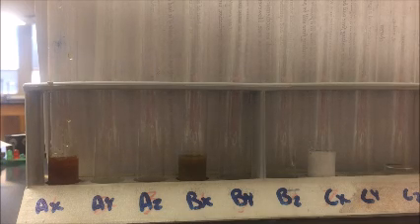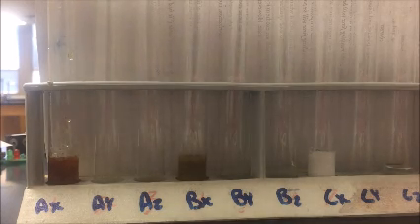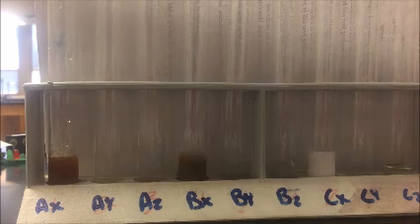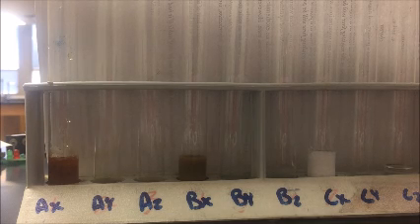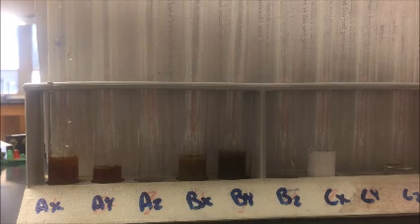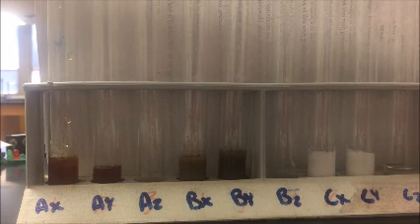Next, I'm going to take compound Y, and I'm going to put it into the AY, BY, and CY test tubes. So there's AY, there's BY, and finally, there's CY.